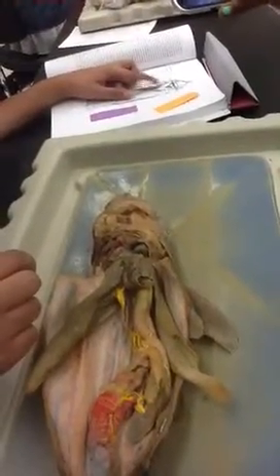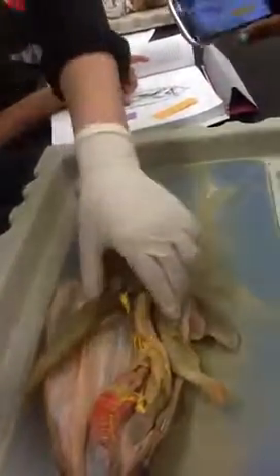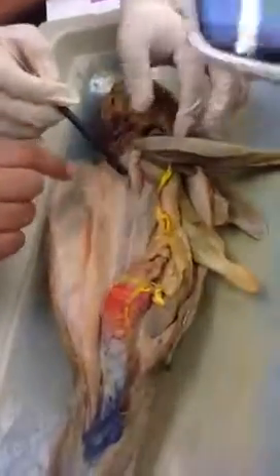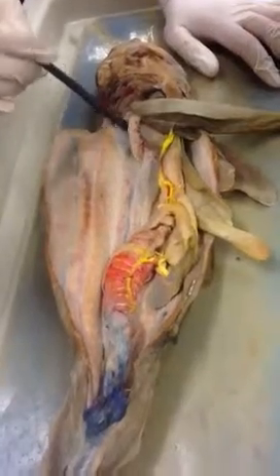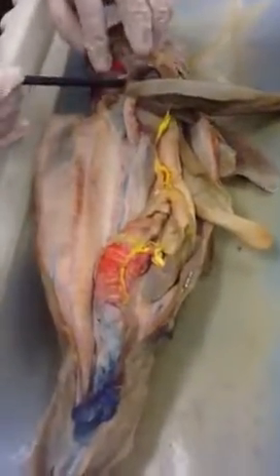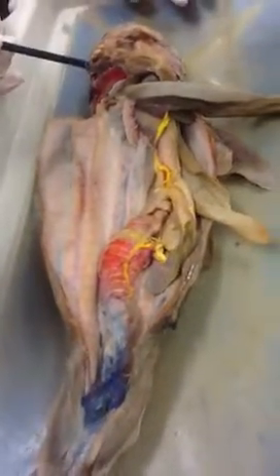And there's also genital sinuses that are next to your posterior cardinal sinuses. It's this one. Well, the thing is it's just a giant thing of latex, it's not an actual sinus. This is a sinus, and then it goes to the sinus venosus.